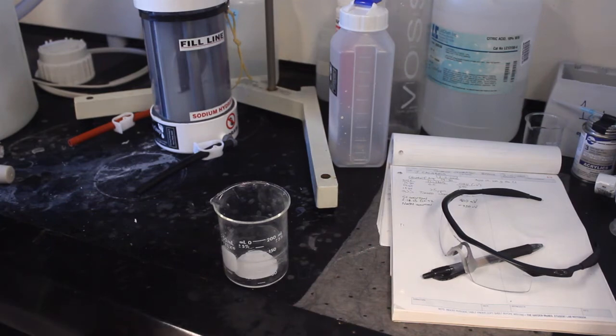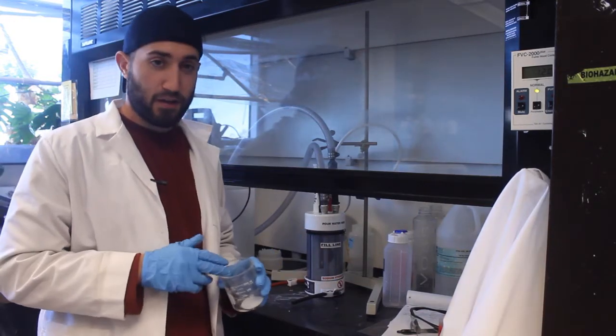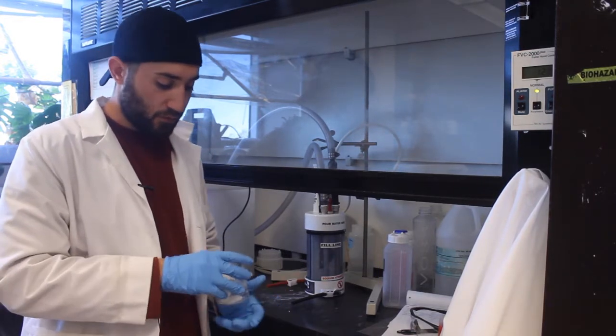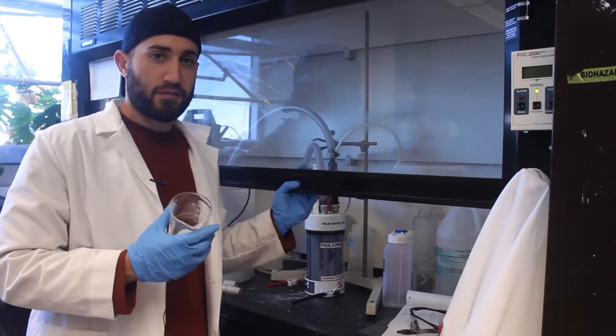And now we're going to let that sit for five to ten minutes. After our five minute initial rinse, it's time to rinse off any excess methanol that would still be on the system. So I generally give it one or two quick more rinses, just as a precautionary. And then we will take this over to the sink for cleaning.